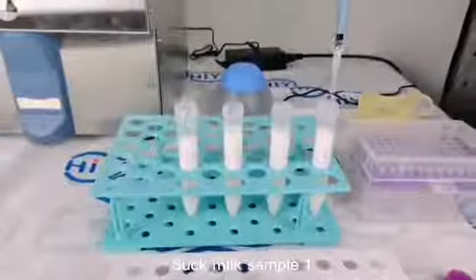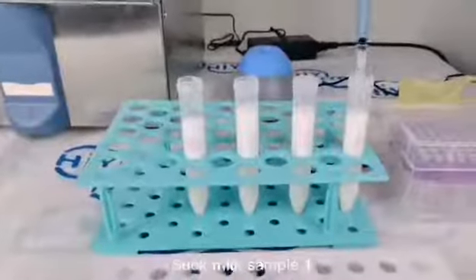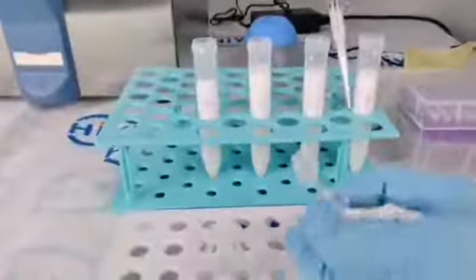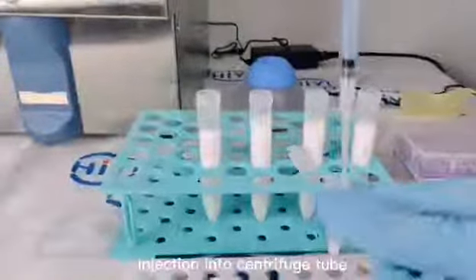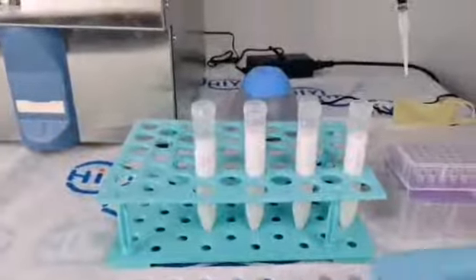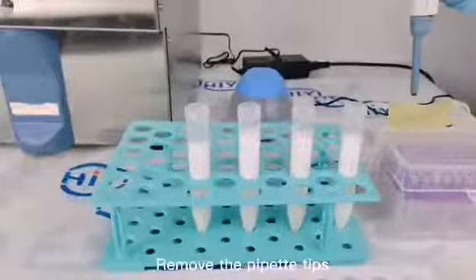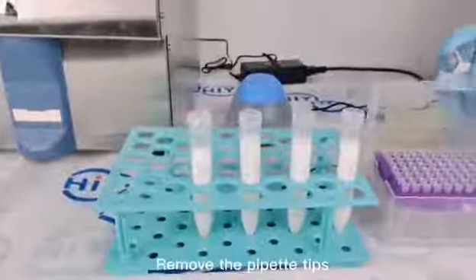Suck milk sample one. Inject into centrifuge tube. Remove the pipette tip.